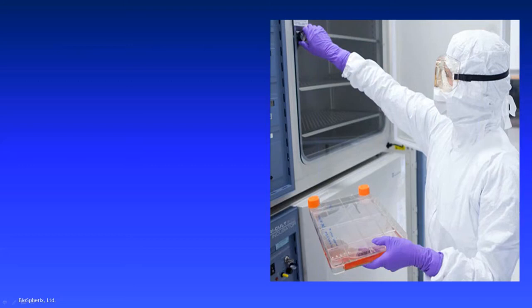And if you think about it, even in the pinnacle of cell culture technology, the cleanest clean room you could find anywhere in the world, you have the same source of variability as you find in the rudest, crudest, most basic lab anywhere. In fact, in clean rooms, it's even worse because people have to wear layers and layers of clothing.